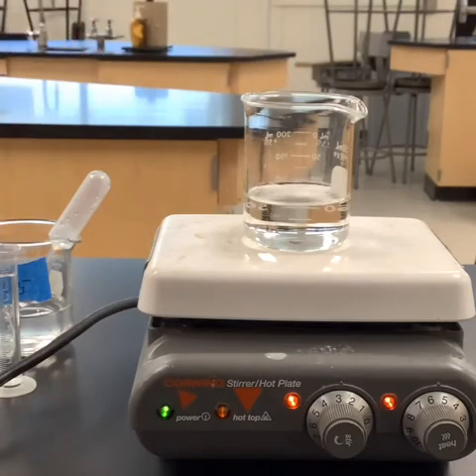And I'm gonna want this thing to start stirring. Now, because I'm doing this myself and I don't have any group members here to help me out, it's gonna be really difficult for me to stir, time, write, and pour all at the same time. So I am going to cheat a little bit.